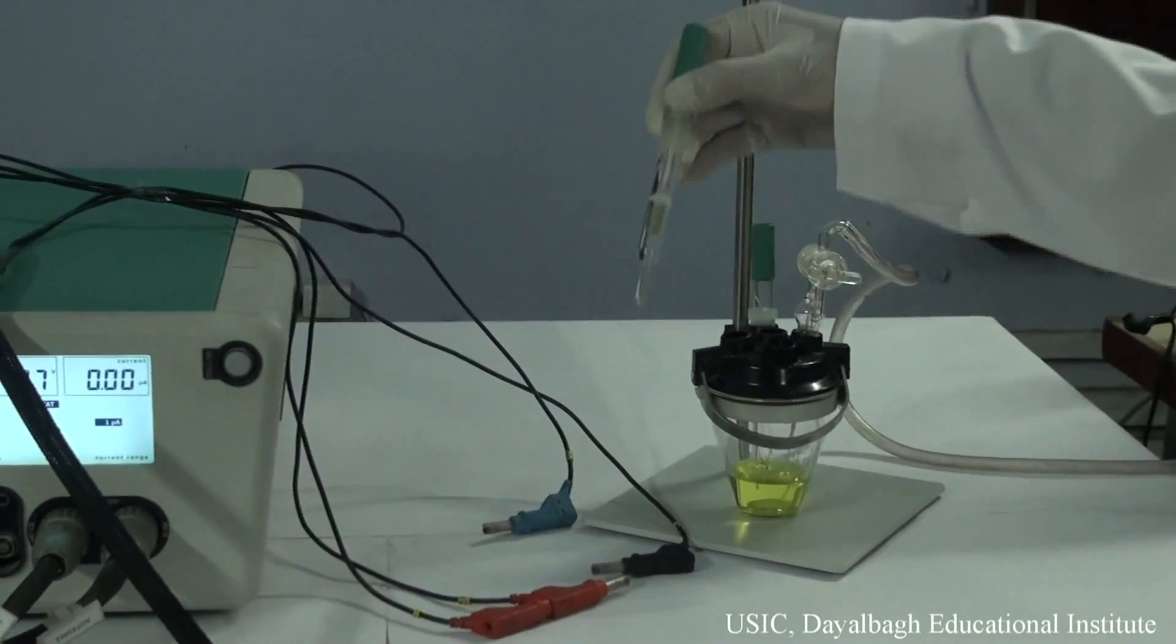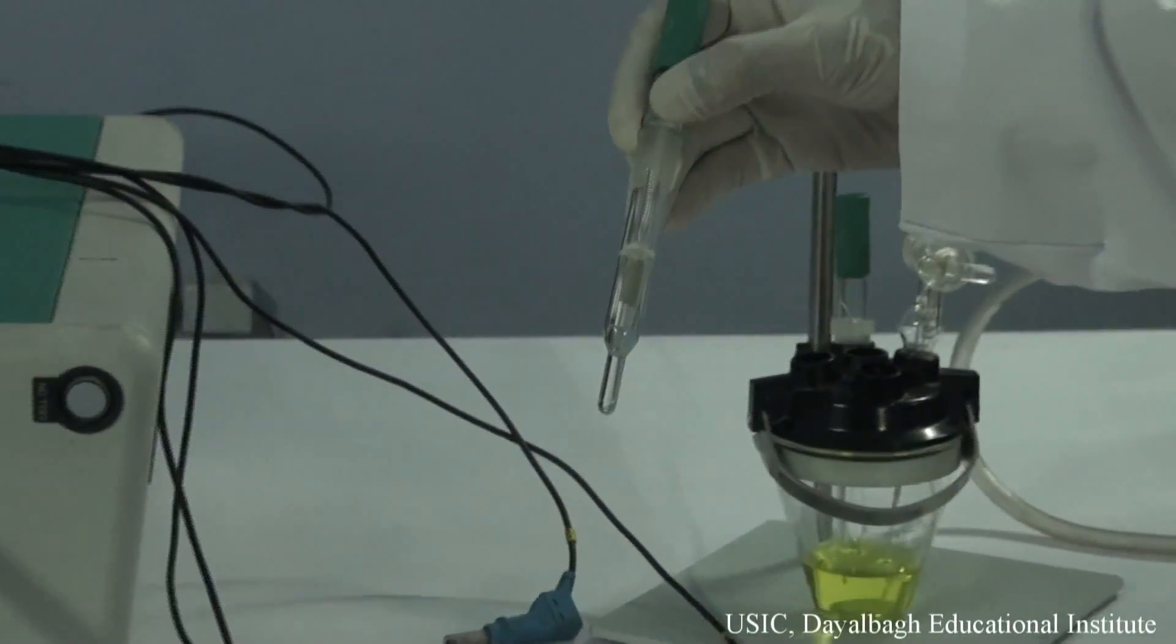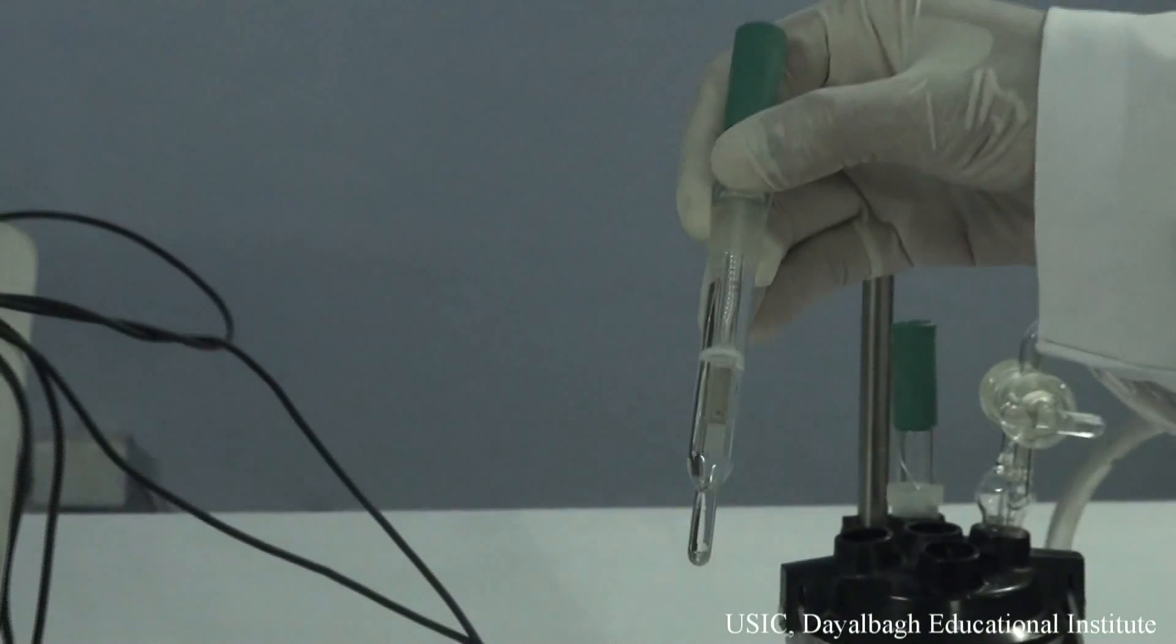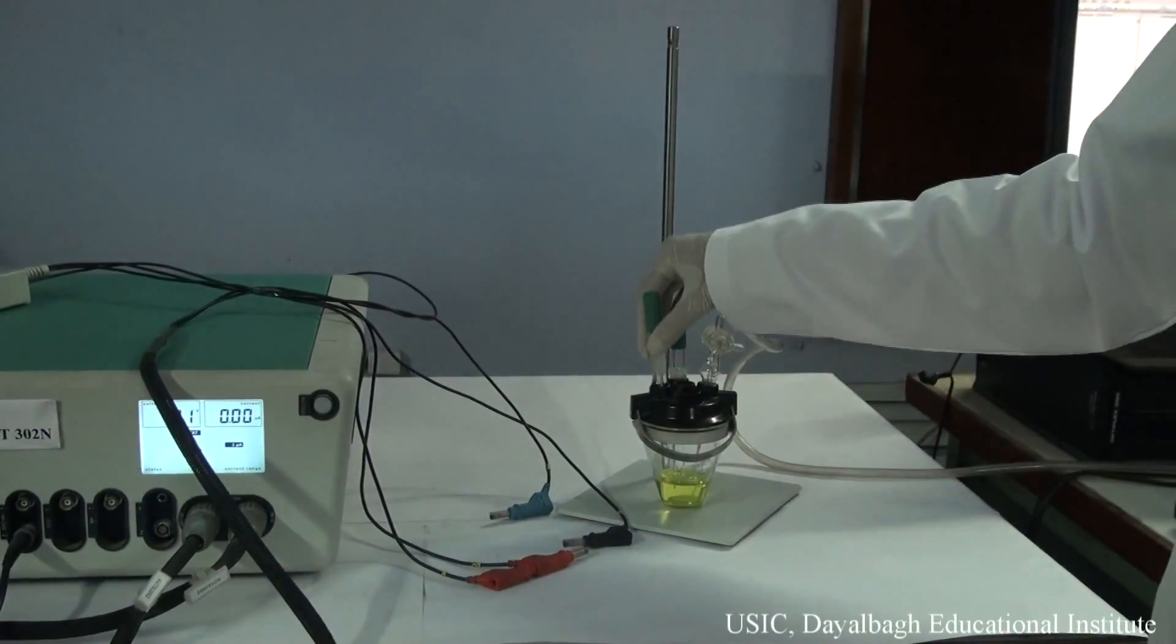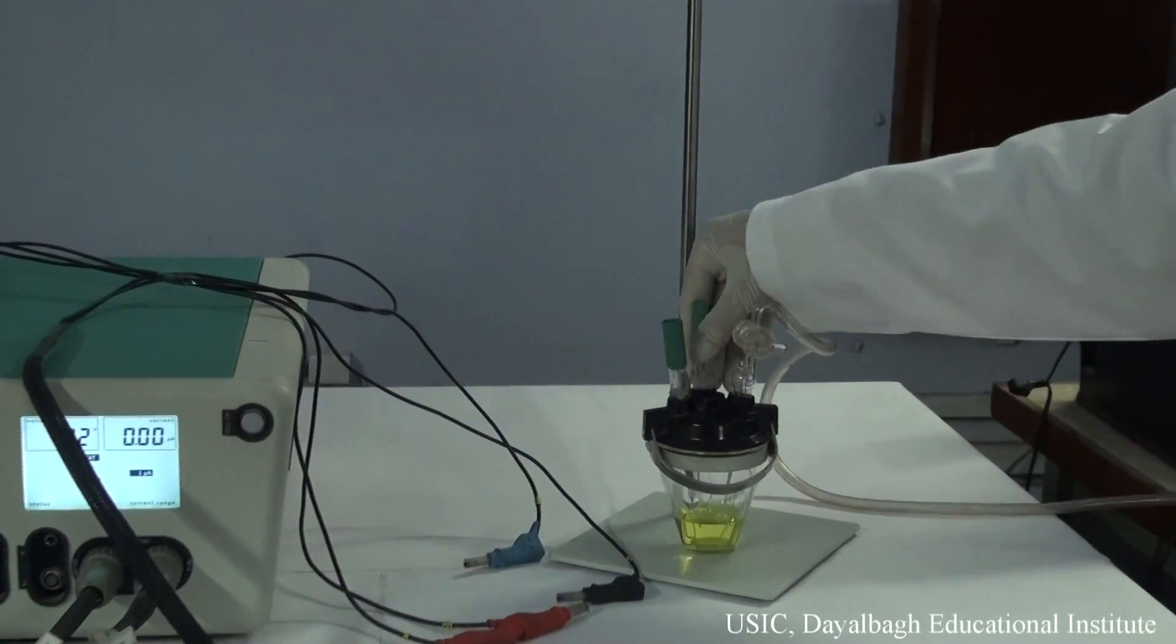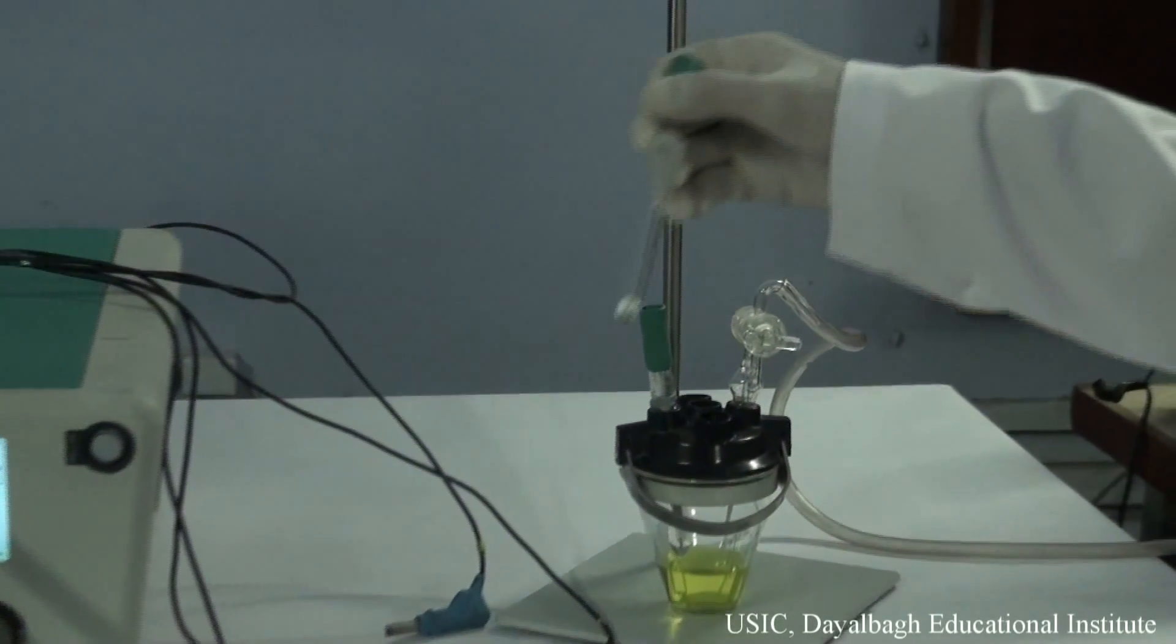This is the reference electrode, i.e., silver-silver chloride electrode used generally for aqueous solutions. This is the counter electrode, i.e., platinum wire.